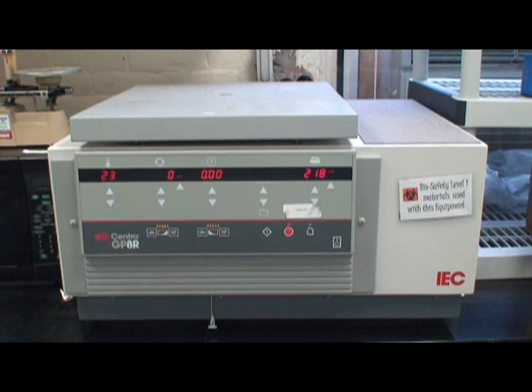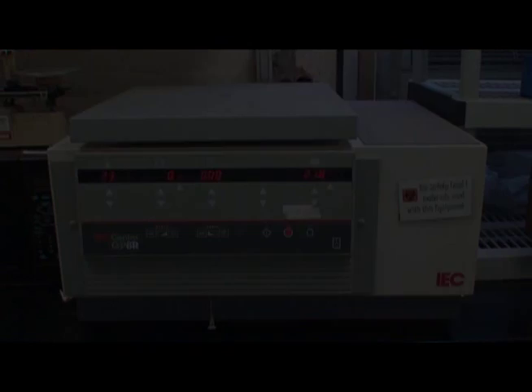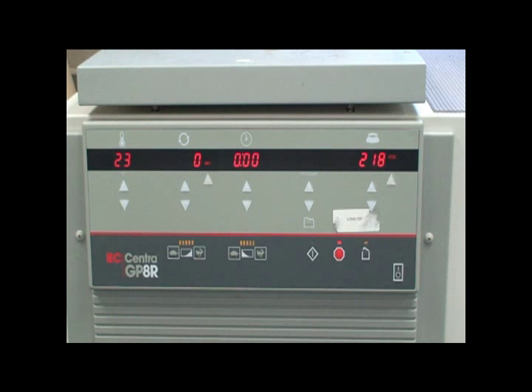Tabletop centrifuge. Seen here is the IEC tabletop centrifuge. The front of the centrifuge is slightly more complicated than smaller versions.